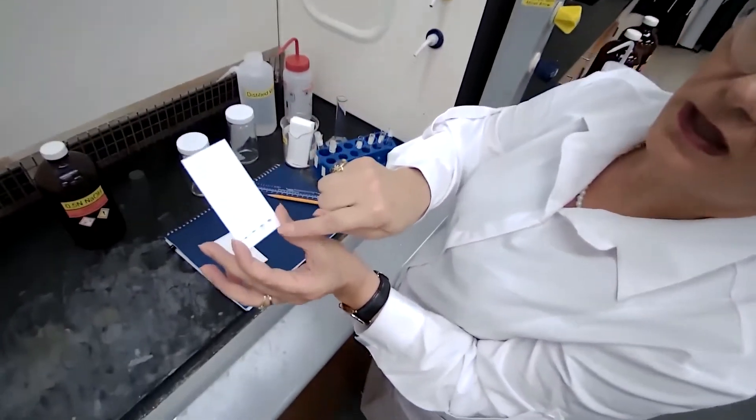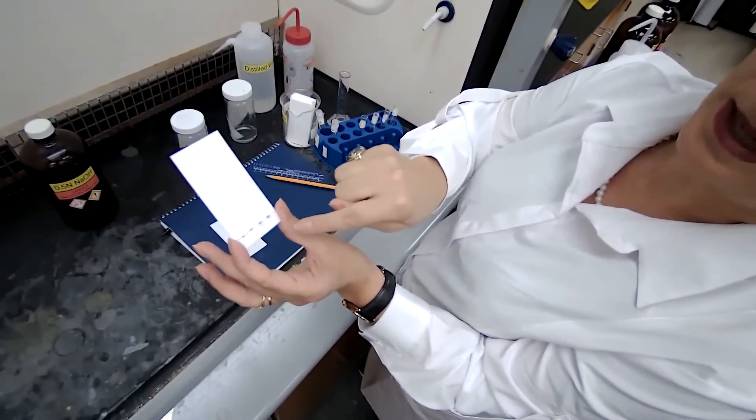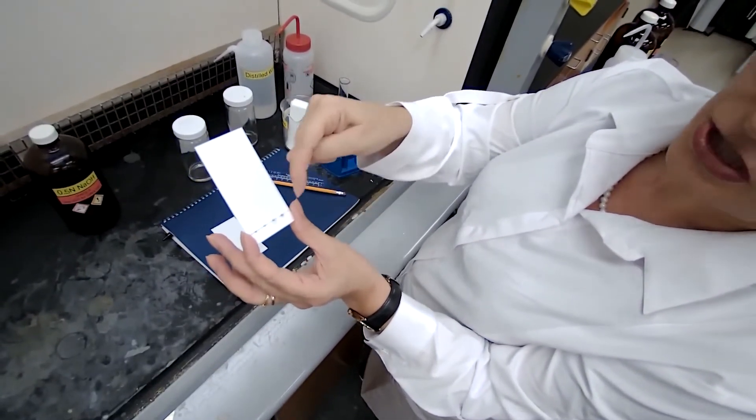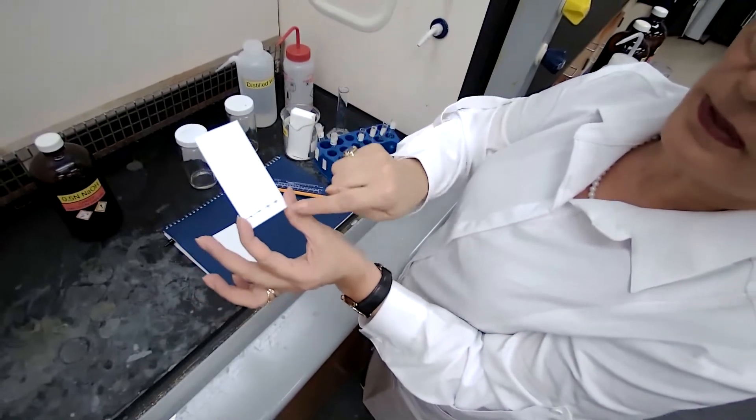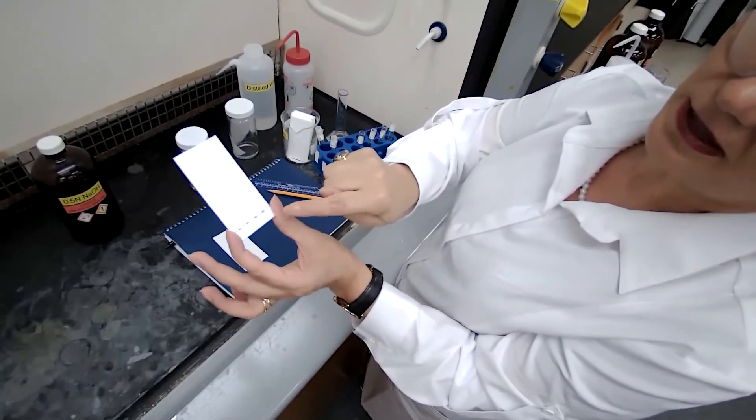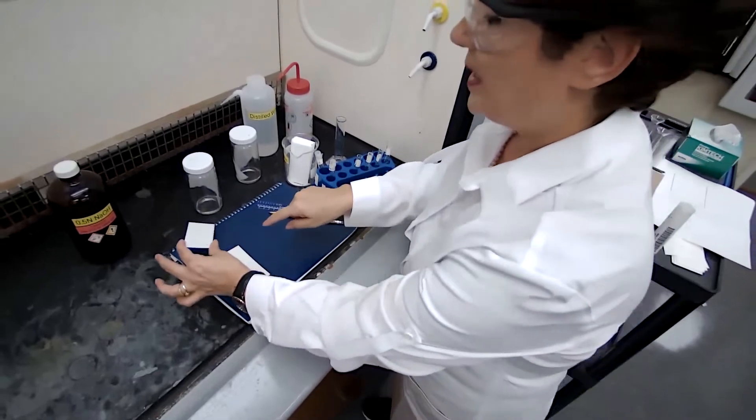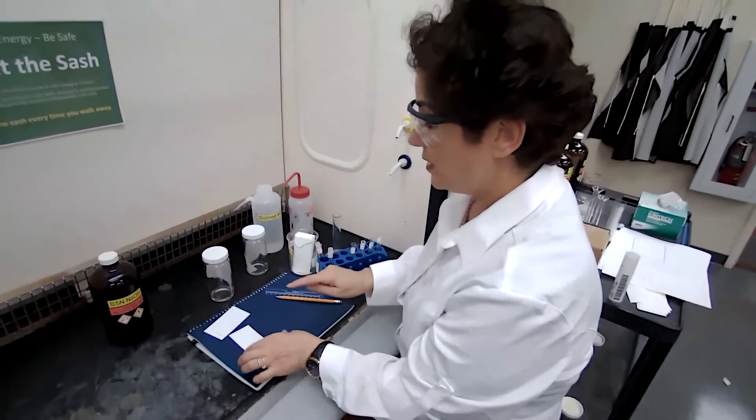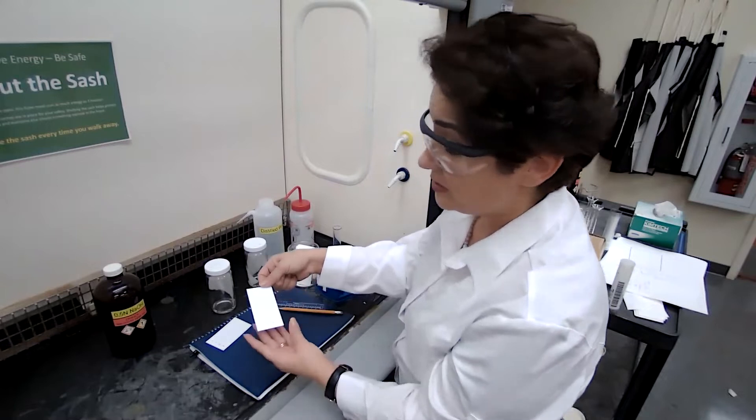I'm going to actually use my second plate because one of the spots got a little larger than what I wanted. It's not touching the others, I would still develop it, but to me it's kind of too large.